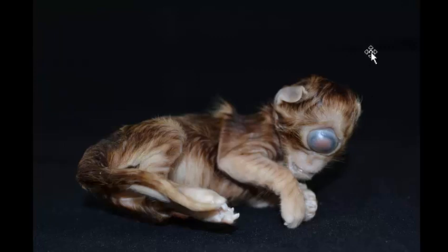This, in animals other than those eating Veratrum californicum, is usually due to a defect in the gene product of the sonic hedgehog gene, which is responsible for the cleavage of structures at the cranial end of the embryo. The eye is the most obvious thing. If we were to remove the brain, we would see that it had a single lobe of the cerebrum, not 2. That condition would be called holoprosencephaly. There's no nose here. Usually, if there are any remnants of a nose at all, they may be up here on top of the eye. So not a common defect, but certainly a classic defect.